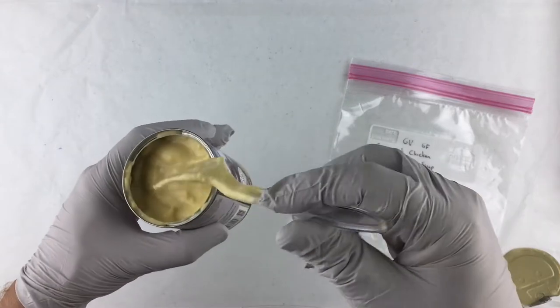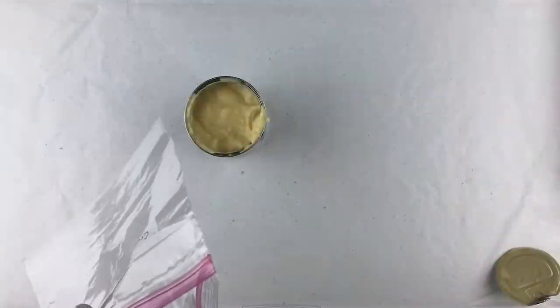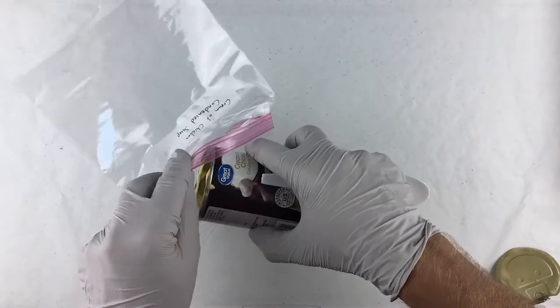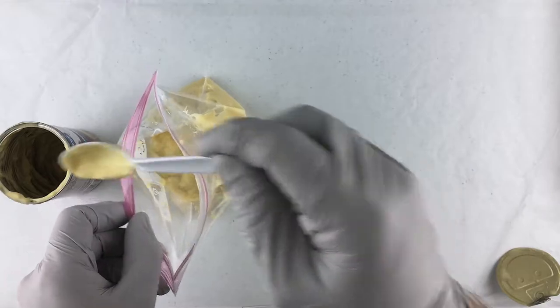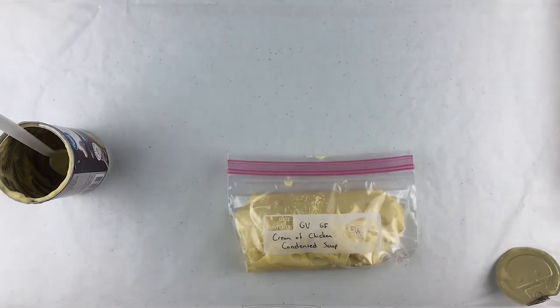Okay, I think that's probably mixed adequately. Now I'm just going to pour this into a plastic bag here. Alright, that will work. We'll see what the tests show.